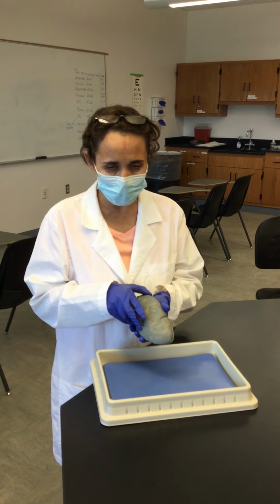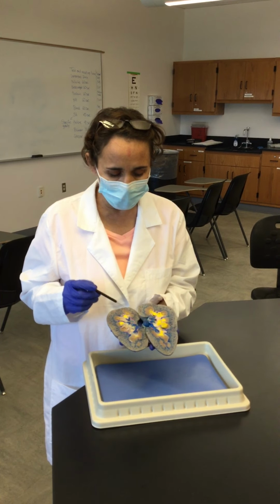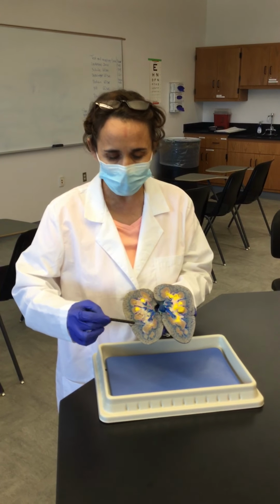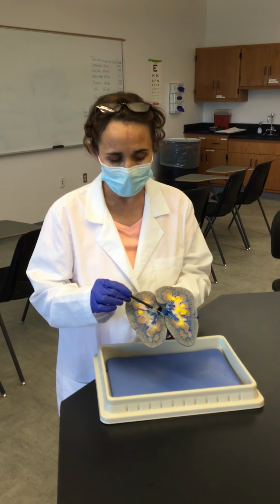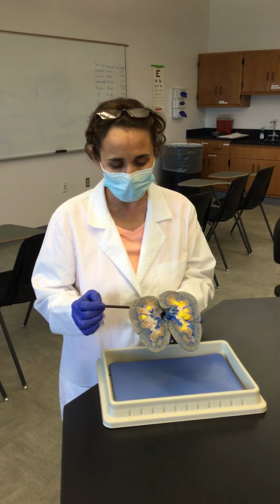And if you make a mid-sagittal section, you will be able to see the internal structures. So the two major regions of the internal structures will be the renal cortex, which will be the one close to the capsule, which is all this, and then this medial portion that is called the renal medulla. And then internally to the renal medulla, we have the hilum, which is a constriction in the medial view of the kidneys.